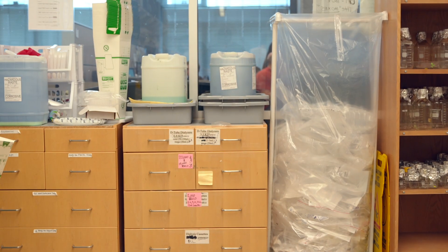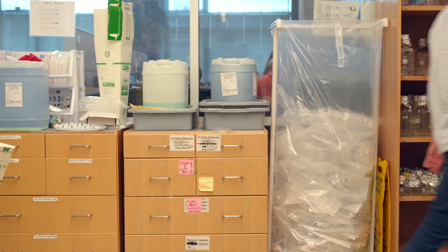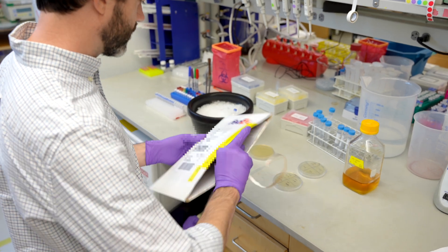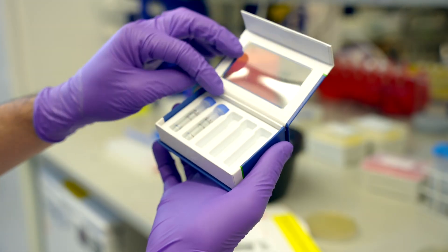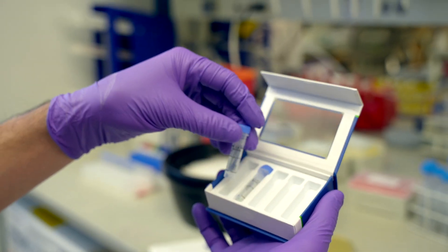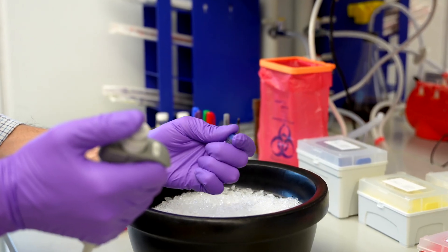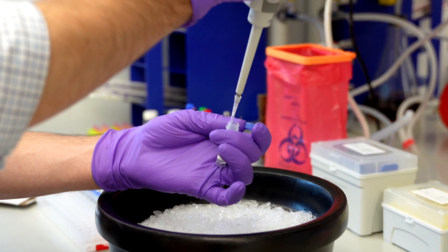The DNA arrives in the mail just like anything else you buy online. The amount we actually receive in an envelope is less than a millionth of a gram — it's so small you can't even see it. The DNA arrives all on its own in an empty tube, so the first step is to add a tiny drop of salt water for the DNA molecules to dissolve into. This just makes it easier for us to measure and transfer the DNA in liquid form.